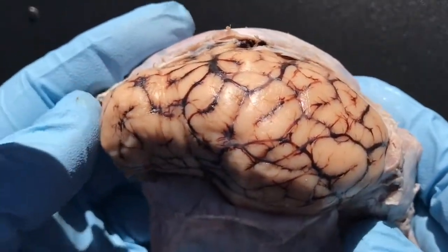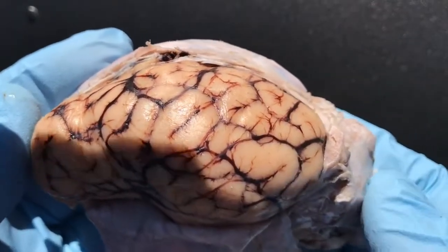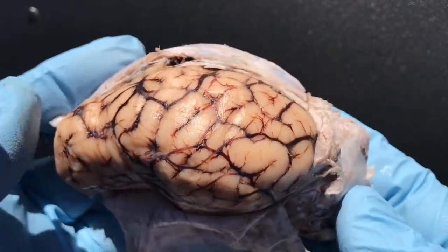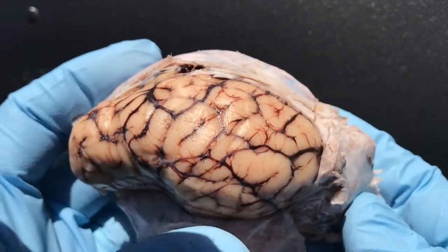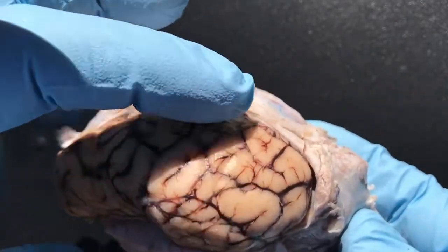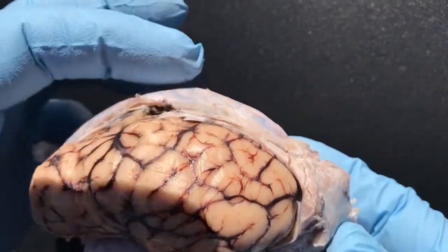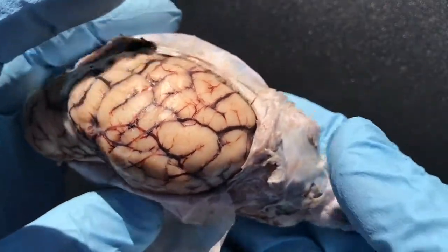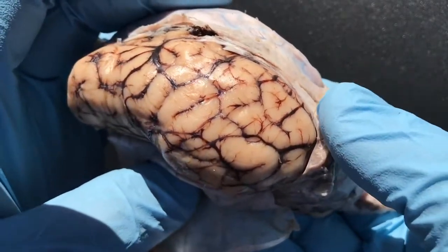So on a human, this would be anterior and this would be posterior here. So this would be the frontal lobe down here, the temporal lobe. Up here, all across the top here would be the parietal lobe, and then finally the occipital lobe would be posterior.